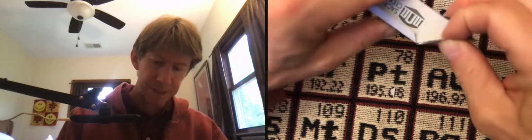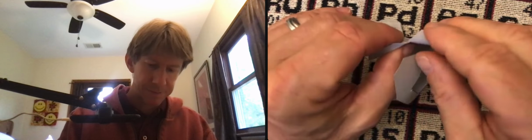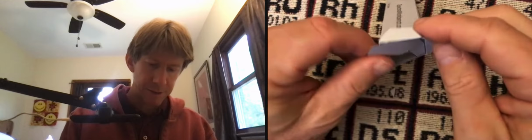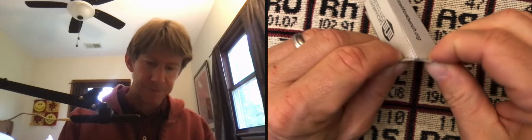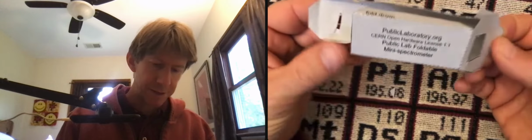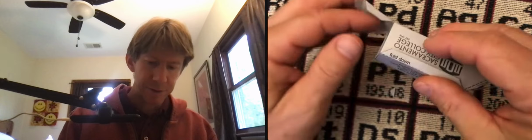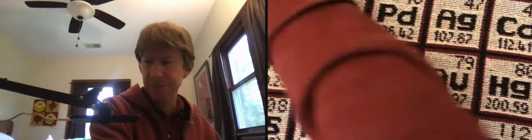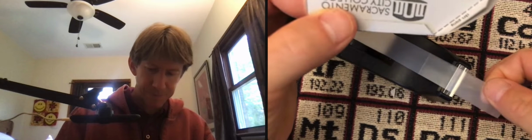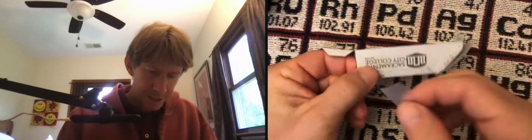And we're going to have these flat portions, and we're going to tape them to the front part here. Oop, fold up. So in a couple minutes, we're going to tape these together, but we're gonna have to put our diffraction grating in there yet. And we're gonna tape these together. And actually, I think the first one to do is to just, let's go ahead and tape this so we get a nice square here. And masking tape is fine. And get it as close as you can.